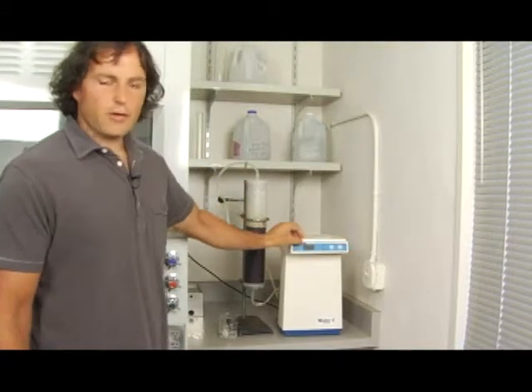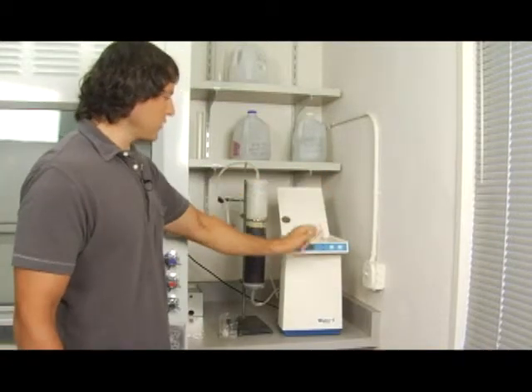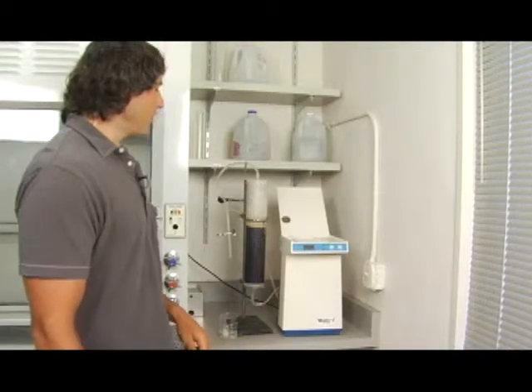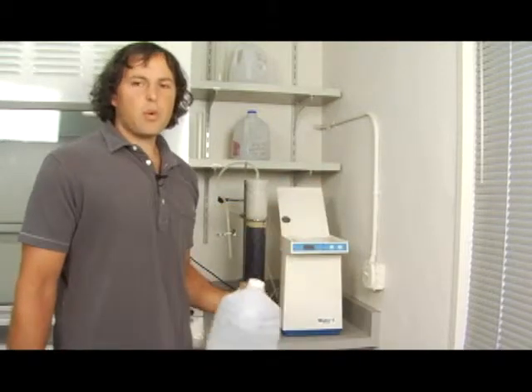What we want to do first is to open this top up and make sure that there's water right here. You'll see that there's a little thing that says pour water here. If that's not near the top, then what you'll need to do is grab this container right here and dump some of the water in where it says pour here.